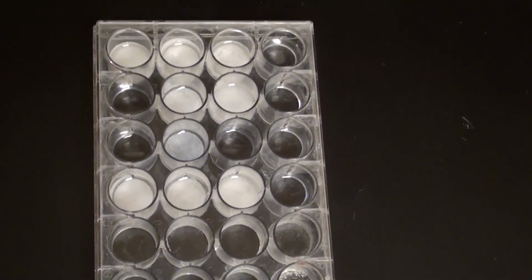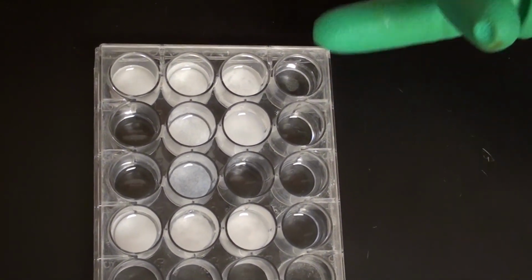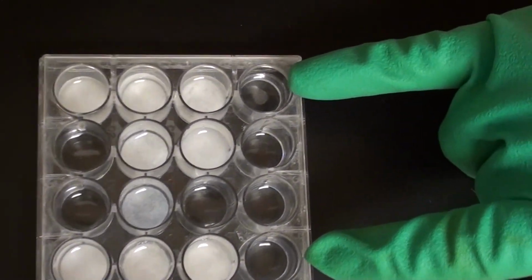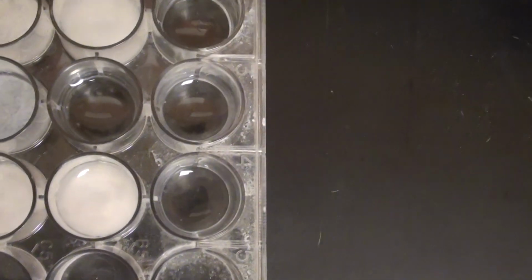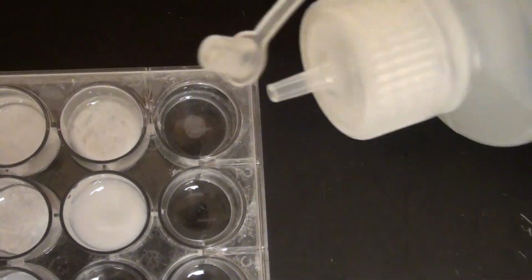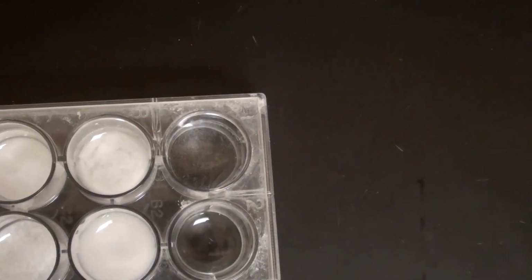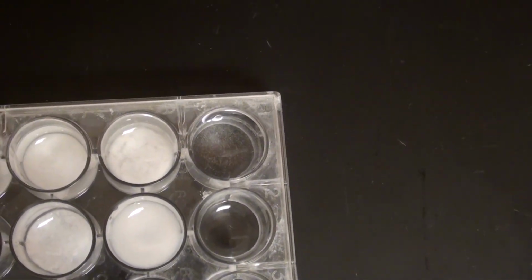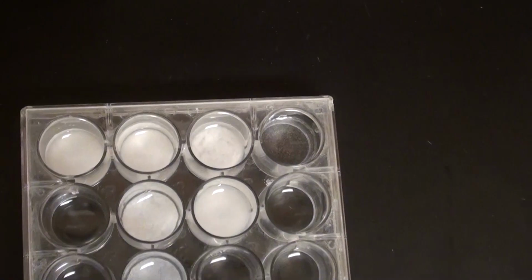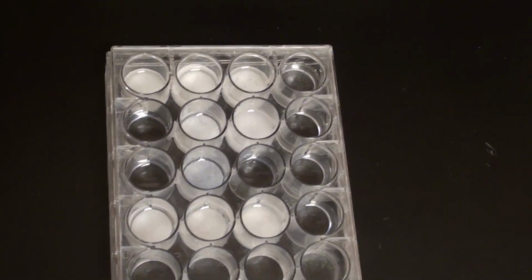So to make this a bit clearer, I've actually put this on a black background here. Now if you look at the first and the fourth rows, in that last one, there is a tiny amount of precipitate, but there isn't any precipitate in the fourth row. So we're going to add a little bit more just to that last one to see if we can increase the precipitate amount. And we have a little bit, so that's a good plan. If you're not sure if there's a precipitate in there, add a little bit more of the anion to that. And then we should have 4 unique results which can be compared to your unknown.